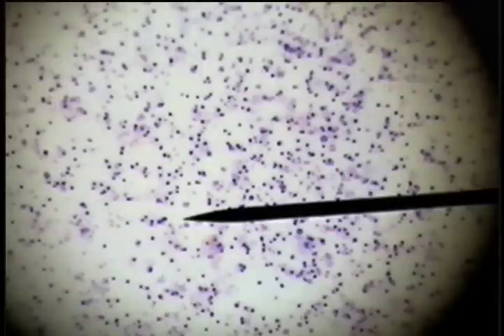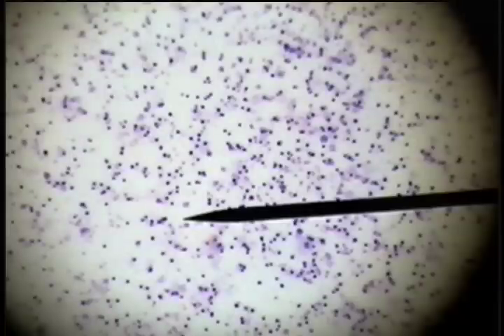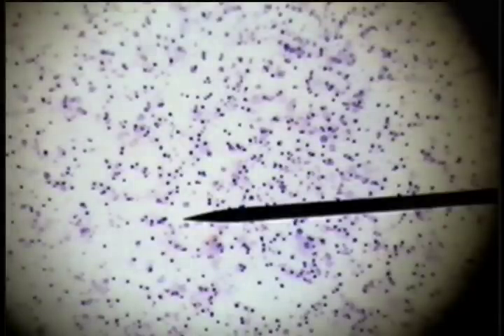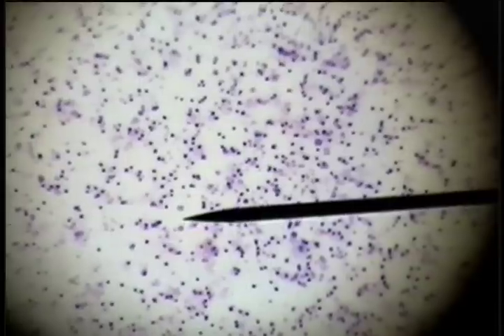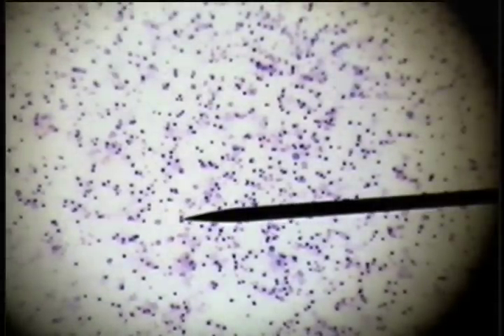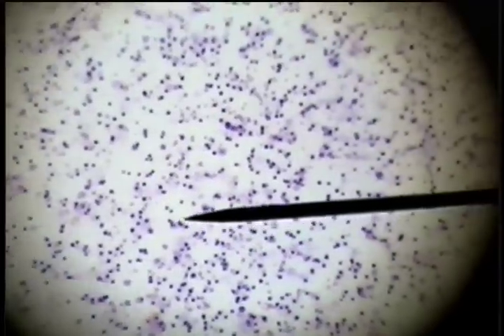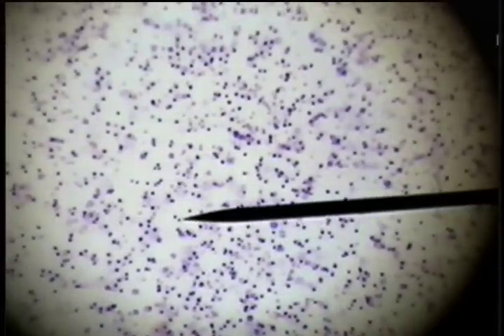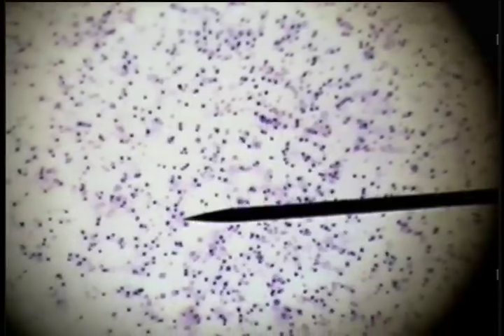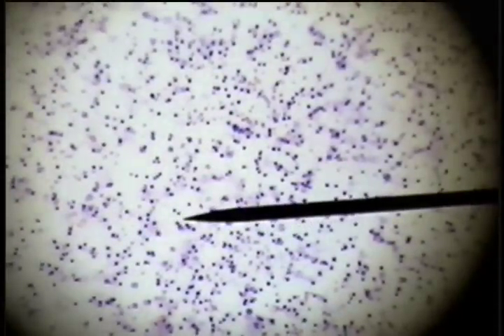This is bone marrow. Bone marrow is where red and white cells develop, and if bone marrow is taken and a slide is prepared, the difference between peripheral blood and bone marrow is that there are some very large cells and some very small cells. That's characteristic of the developing blood cells — the immature cells are very large, and the small cells are the mature cells.